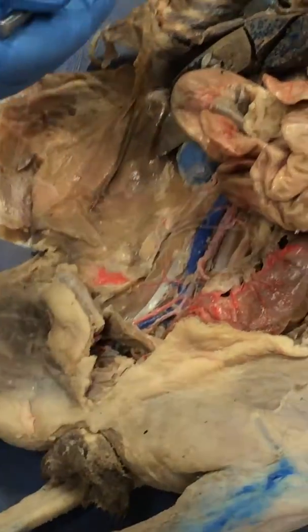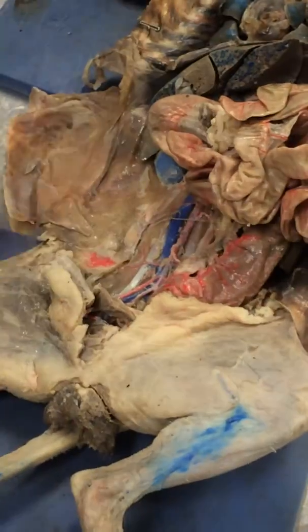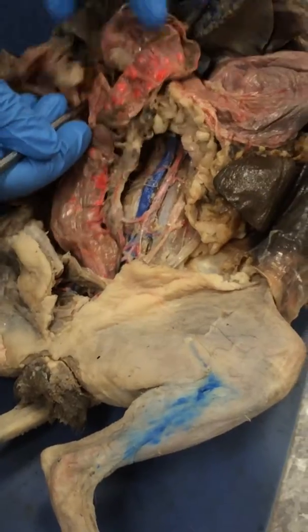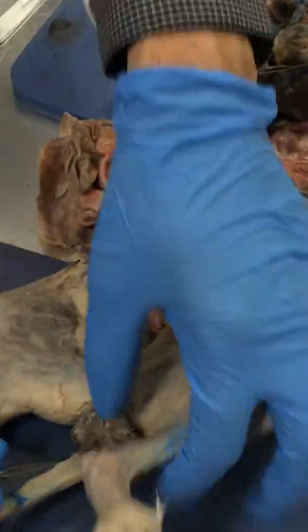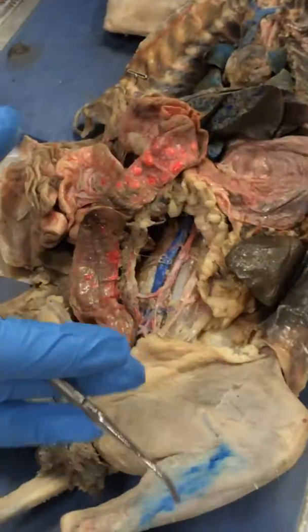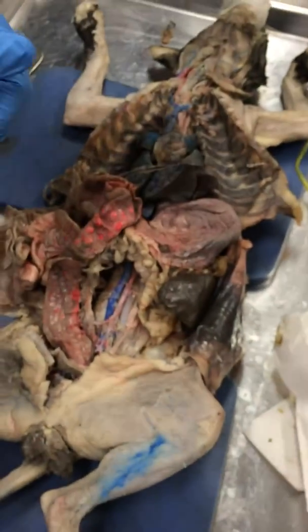Also remember the information that was in your lab manual in the exercises: the parietal cells, chief cells, the epithelium in the lumen of the intestines here, the epithelium in the esophagus, where it changes over at the anus. So integrate all that knowledge from the lab manual and the dissection, and I'm going to go over the histology right now. Okay, all right.